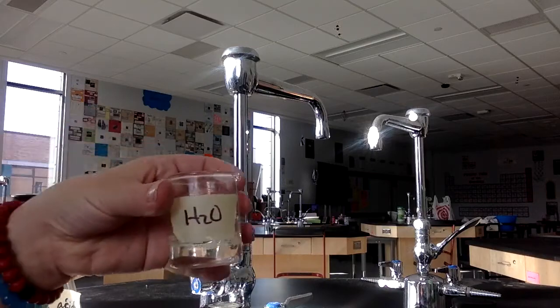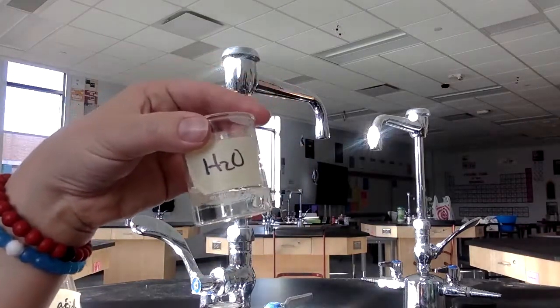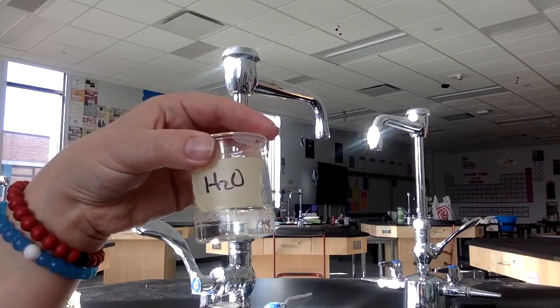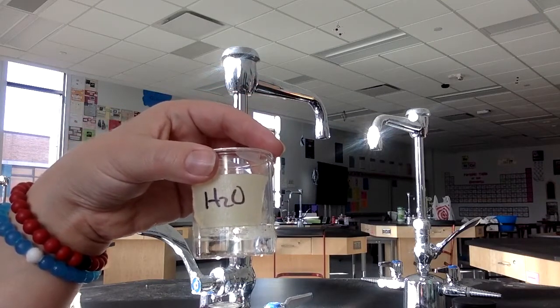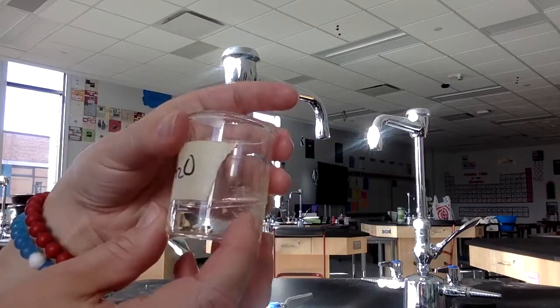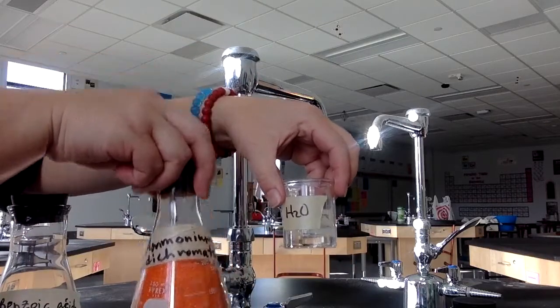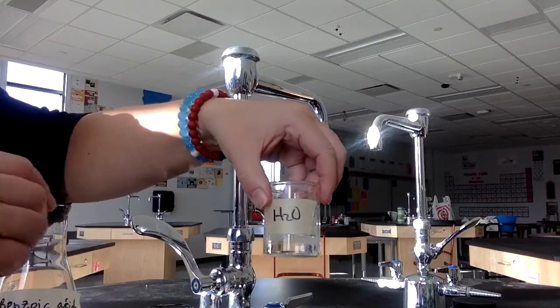Okay, our next sample we're going to use is water, and I know you know what water looks like, but I want to show you what 1 mole of water looks like. So you can see that the chemical formula is H2O. The description is that it's a clear liquid. This is a 50 milliliter beaker. That's how big this is, so to kind of see it in reference to other containers. And it's about 18 milliliters.